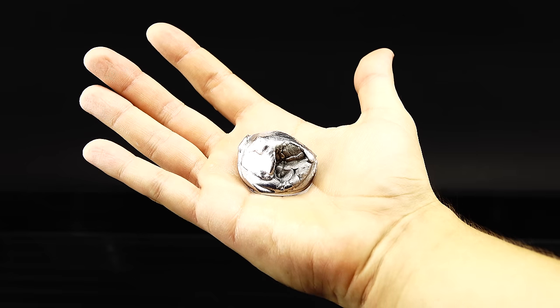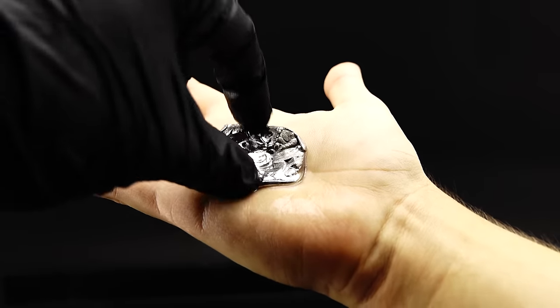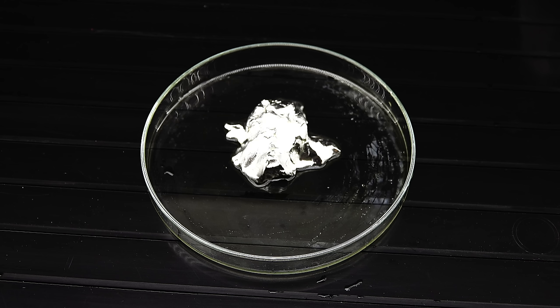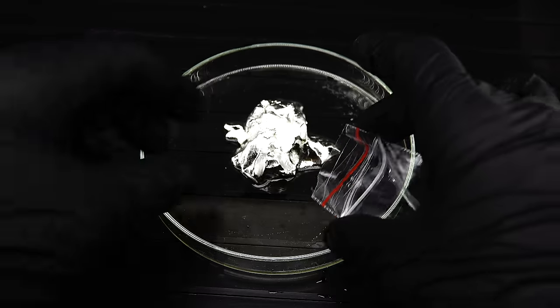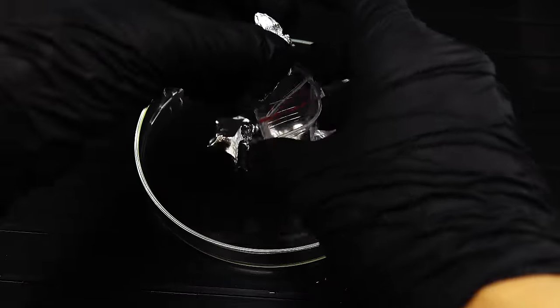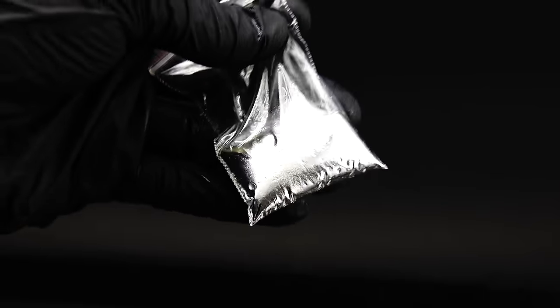Upon contact with my hand, the amalgam feels just cold and heavy, and holding it is unlike anything I ever experienced. Anyway, now that I have done all the tests, it was time to seal this thing up for storage, and for that I used just a small plastic bag, which looks really weird with the amalgam in it, and will be stored in a bigger bag with sulfur in it, to prevent any mercury vapors from escaping.